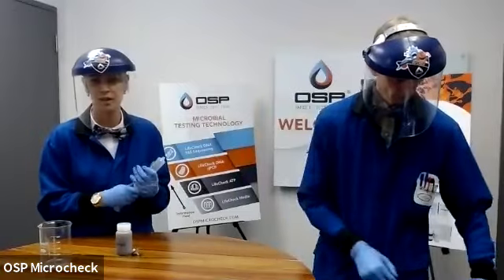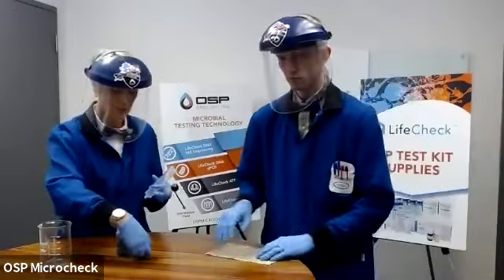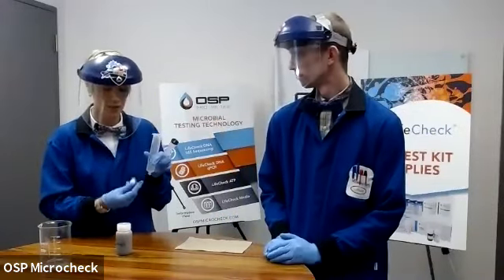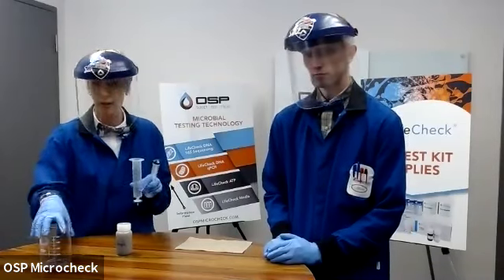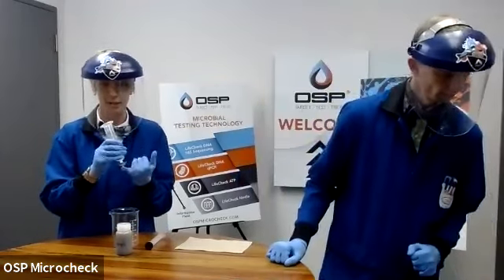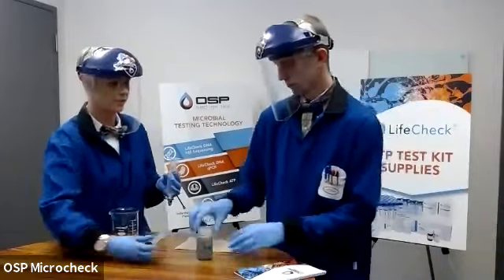Depending on how big of a sample or the mouth of the container that you're using, that might be difficult. What I prefer to do is to pull the plunger out. Never pull air through this filter, so always make sure the plunger's out when you're changing reagents or putting it on, like so. Have your waste container. I place it on my finger and hold it like this. Mark, would you mind opening my sample? Sure.